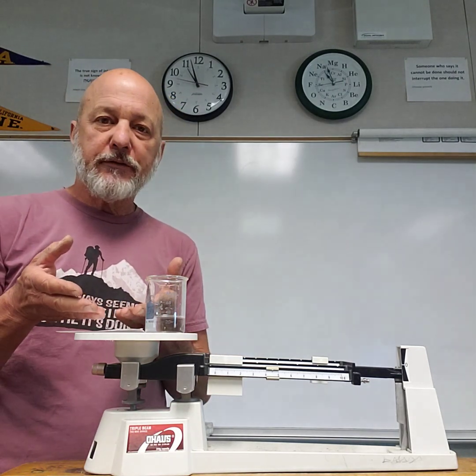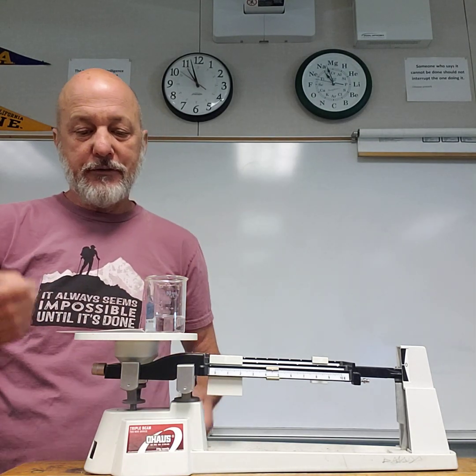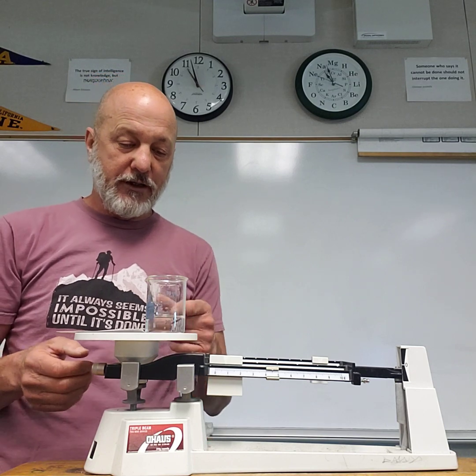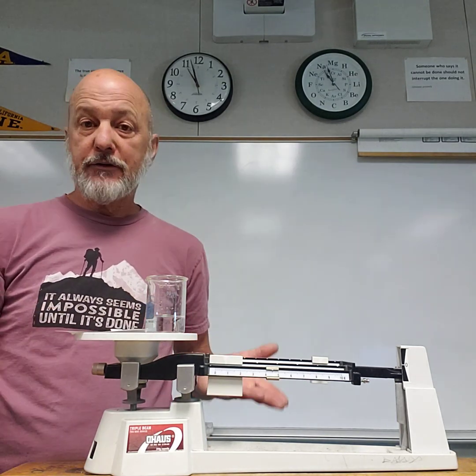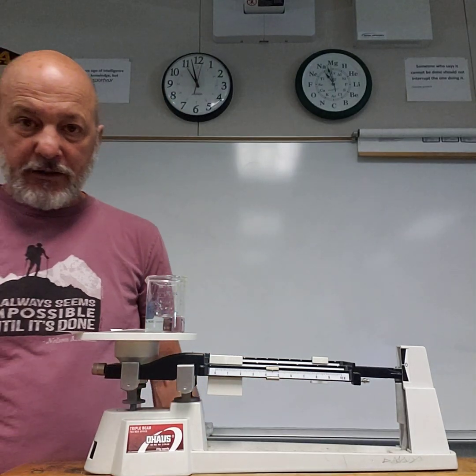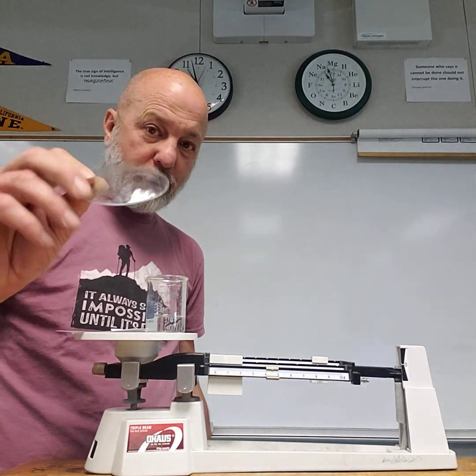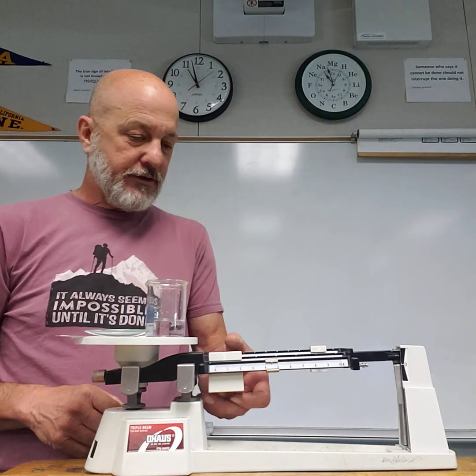If some crumbs of Alka-Seltzer came off, I will be able to keep them on the paper. Otherwise, if I just drop the Alka-Seltzer tablet on the tray without the paper, then some crumbs would come off, and I would see a change in mass if I was sensitive enough. This little round glass called a watch glass, I'm going to weigh this too. And you get your mass.